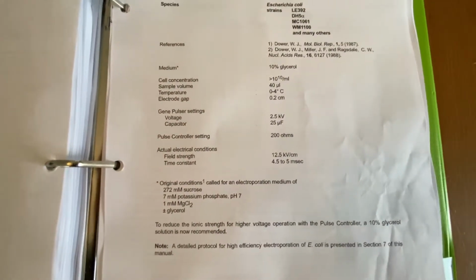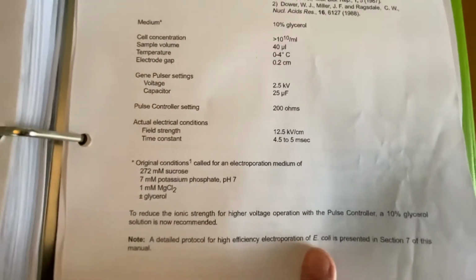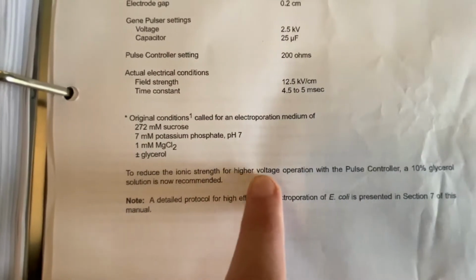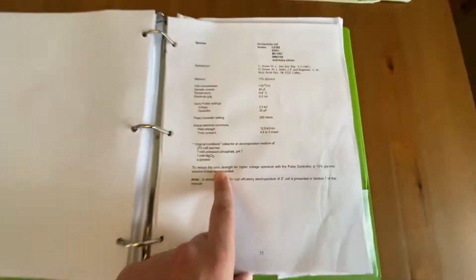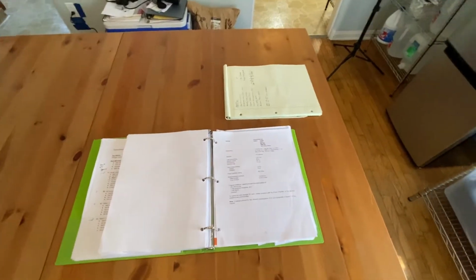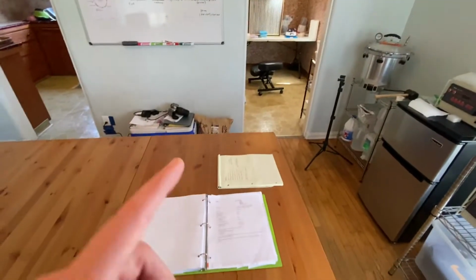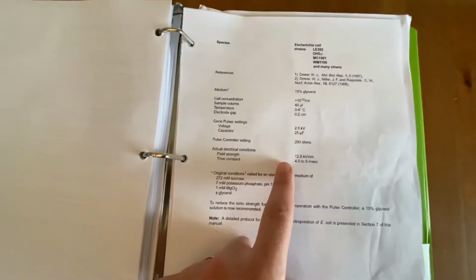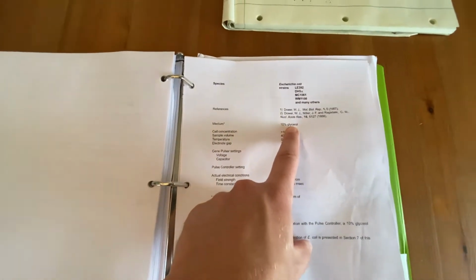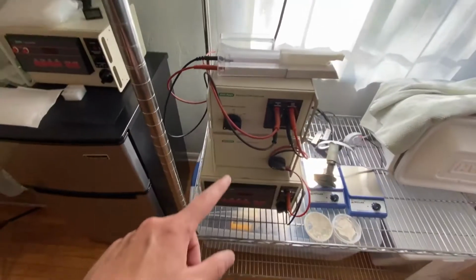The other thing I want to mention is this particular paper, unlike the other protocols, actually calls for the final washing step to be done with 10% glycerol. And if you read, it says to reduce the ionic strength for higher voltage operation with the pulse controller, a 10% glycerol solution is now recommended. And so that is something that I actually, in my last few attempts, started doing. So I'm doing the normal washing step, but after the third washing step, I'm resuspending everything in a 10% glycerol solution. And so I think that's partially been what has helped me with running some of those electroporation attempts.